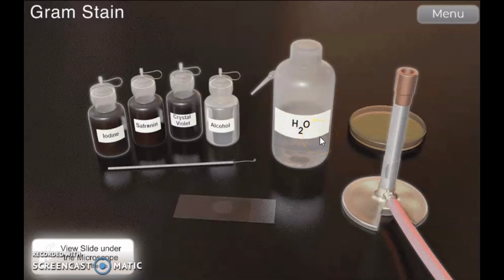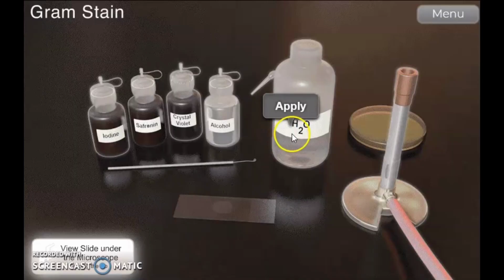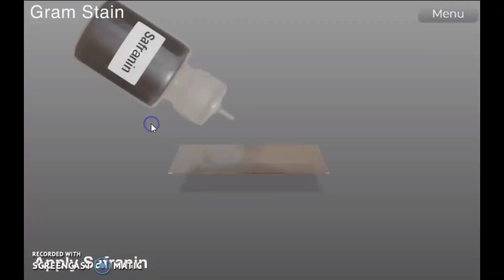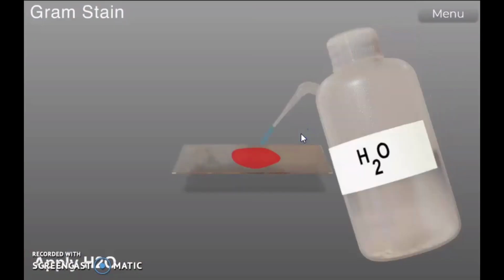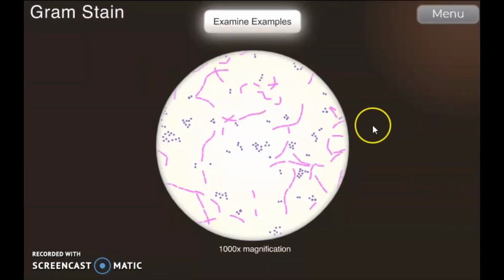Next, decolorize with alcohol for 5 to 10 seconds. And then rinse with H2O. After that, flood the slide with safranin for 1 minute. And then rinse with H2O again. And lastly, view the slide under the microscope. This is the result for the lab simulation gram stain.